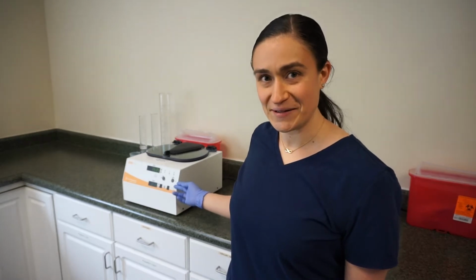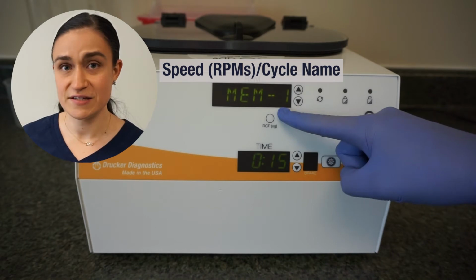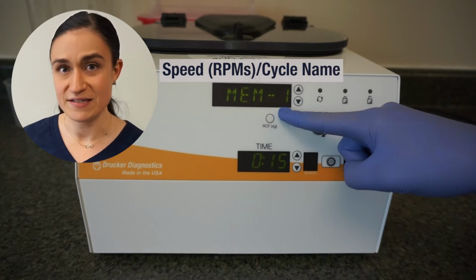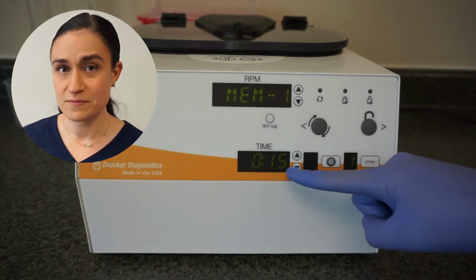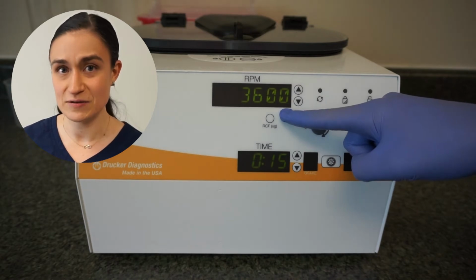As a quick reminder, your SERO 12 has all of its controls right here on the front panel. The RPM screen, which shows the currently selected RPM, and if you have a saved cycle selected, shows the name of that currently saved cycle. Keep in mind, if you do have a saved cycle selected, all of these screens will display the value for that cycle saved into your SERO 12's memory.